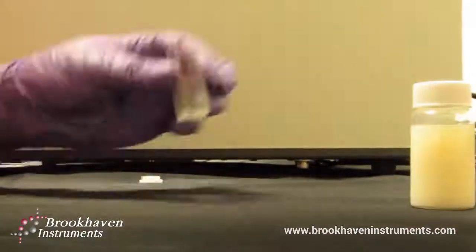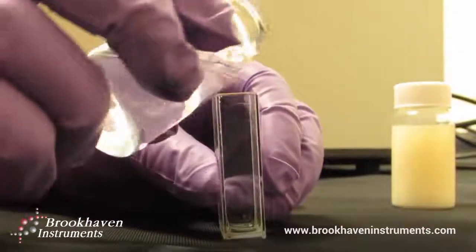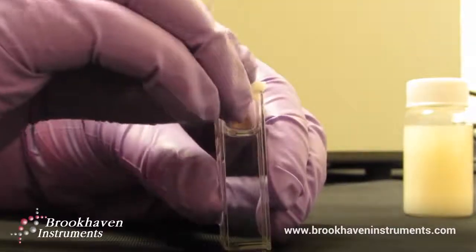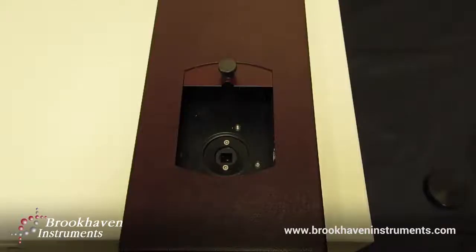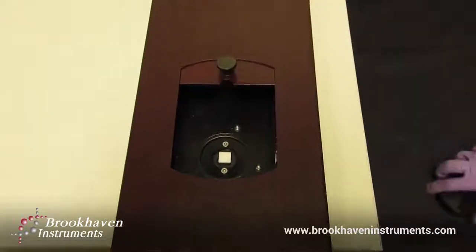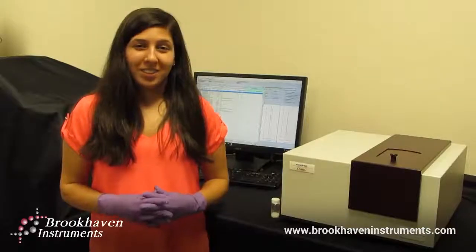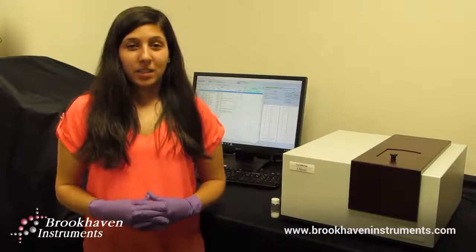To a glass cuvette, add the prepared sample and cap. This is now ready to be inserted into the instrument for measurement. The lid helps maintain a stable thermal environment as controlled by the software. Using Particle Solutions, the software package for the line of Nanobrook instruments, we will conduct a dynamic light scattering measurement.